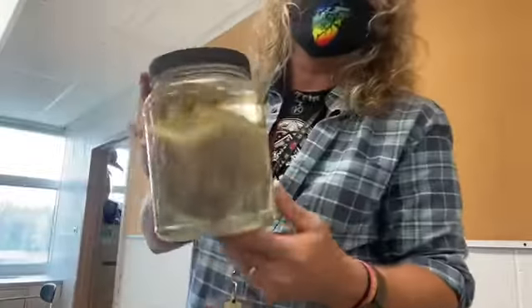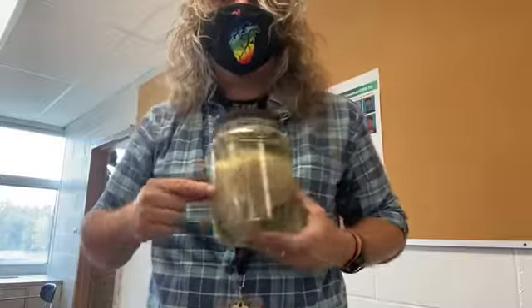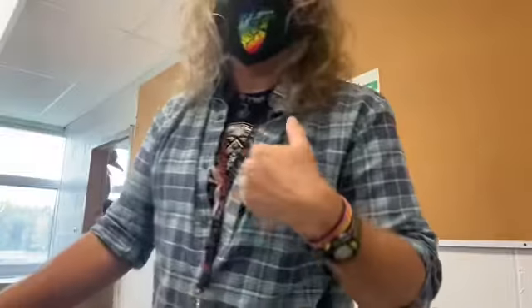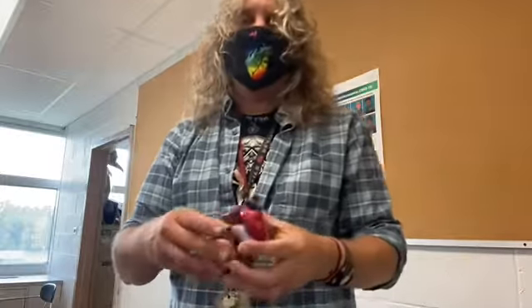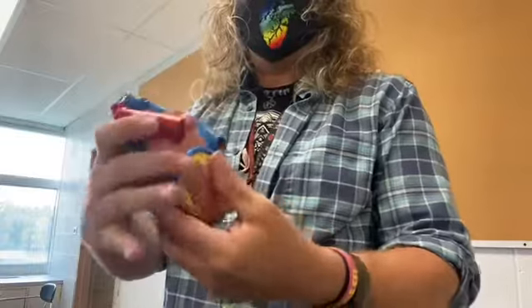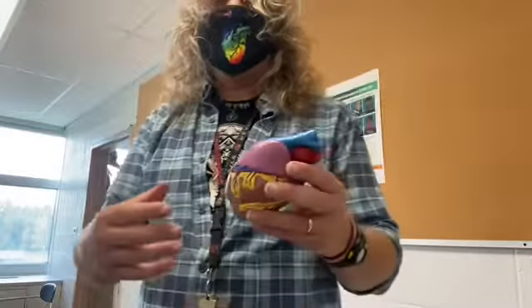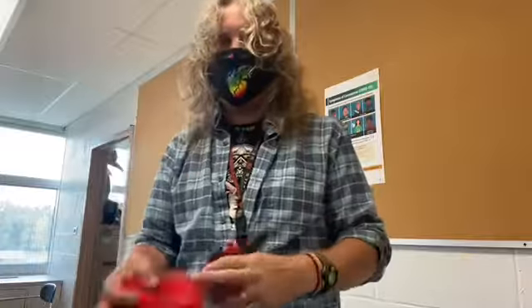We're going to open up some hearts today. Mammal hearts all work the same. This is a cow heart — look at that, huge, way bigger than mine. It would work in my body, it just would be too big and probably wouldn't fit. Our hearts are about fist-sized. What's cool about a model is everything's a nice different color, but real hearts — everything's kind of the same color. These hearts won't be red; what makes hearts red is blood.